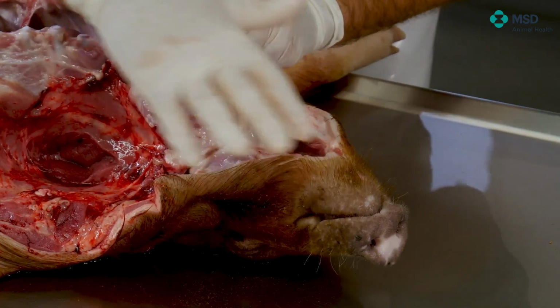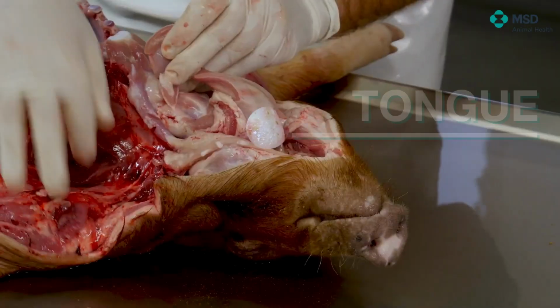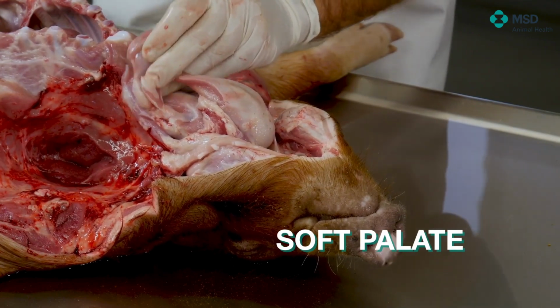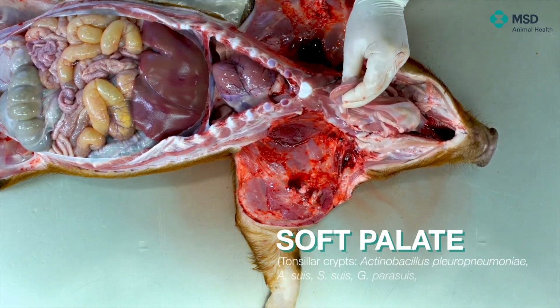In the oropharyngeal ring, we have one very specific area that I would like to show now, which is the tonsil. The tonsil is visible just there. It's the soft palate, and you will recognize it because there's a punctiform drawing which corresponds to the tonsillar crypts.